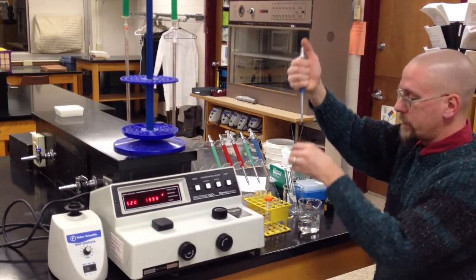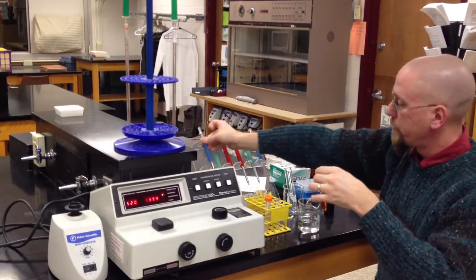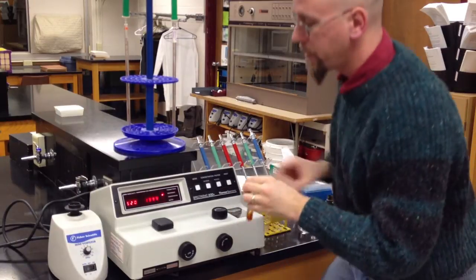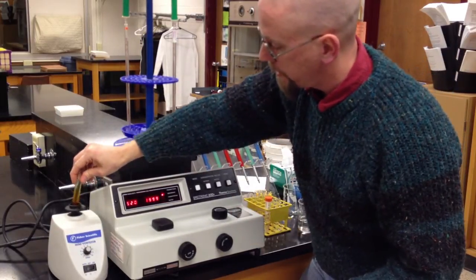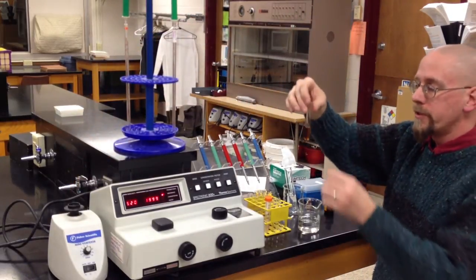I can then deliver that into my test tube. We have a vortexer here. Put that down on there. It'll mix it up real nice. Why are we doing this?